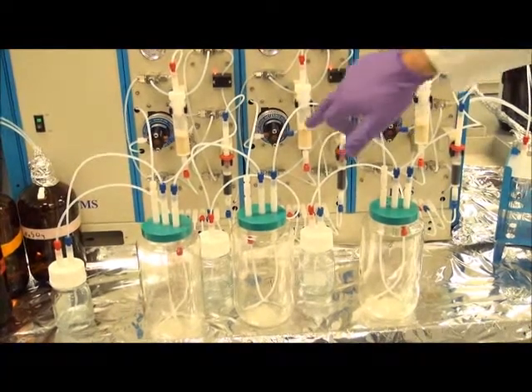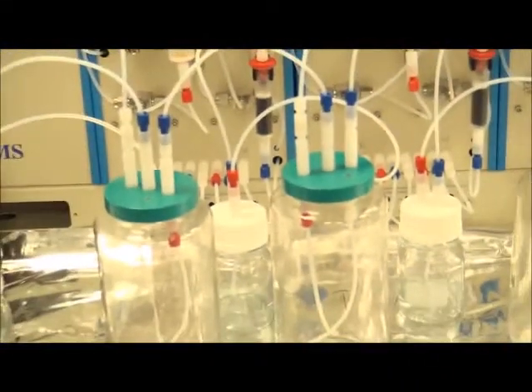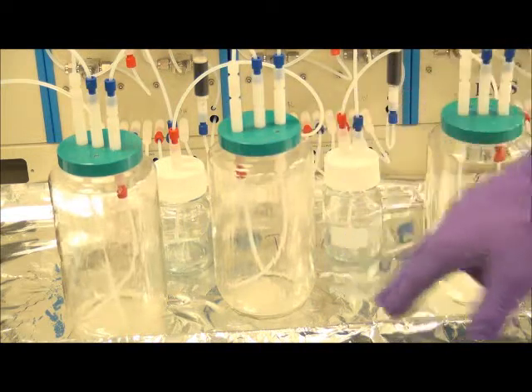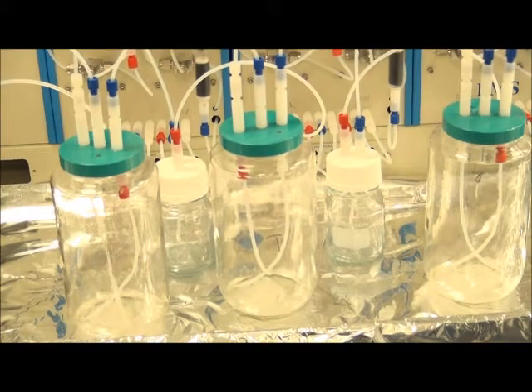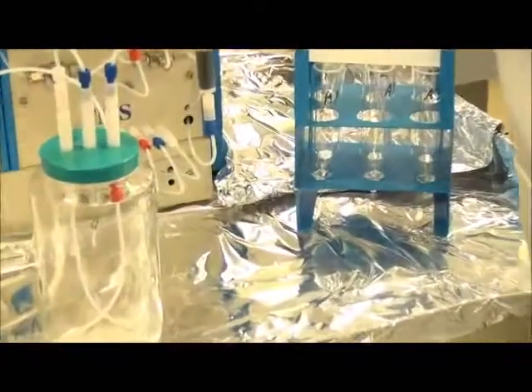And after a brief solvent exchange of the pump, we'll then spray the bottles and rinse all the sides and the particles with methylene chloride. And you can see the methylene chloride spray rinsing the bottles, after which it'll then be drawn back up and eluted across the cartridge and collected in the fraction vials. Now we've begun drawing that up. And simultaneously eluting the cartridges.